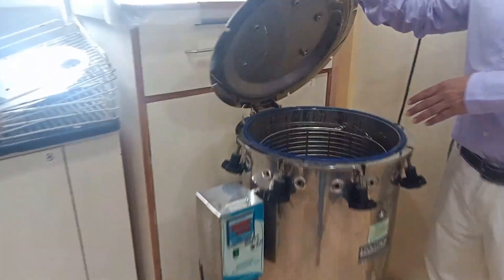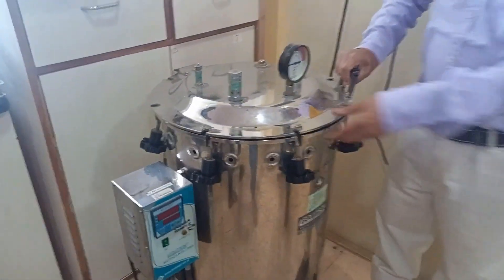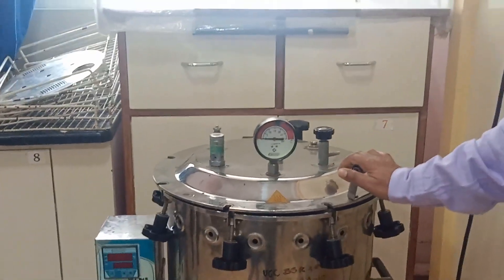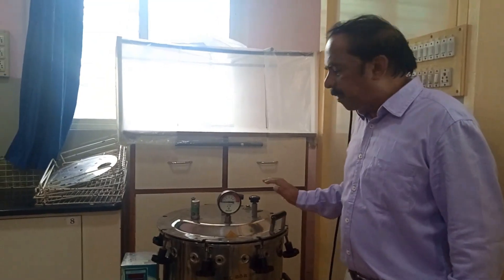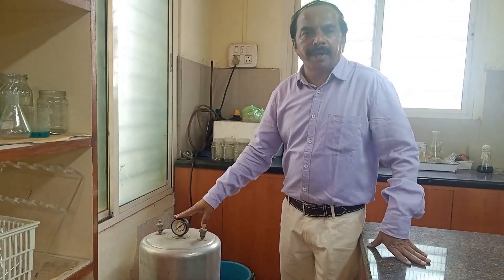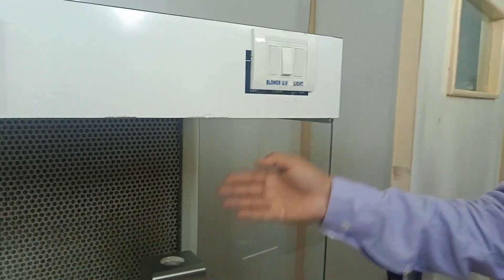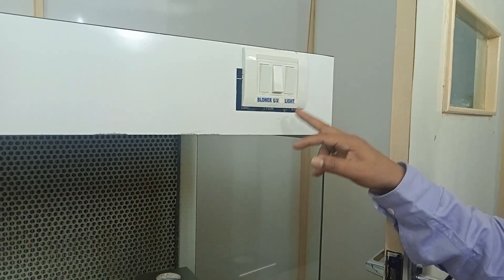Once the nutrient media is prepared and placed inside the autoclave, the lid is closed and pressure is monitored on this meter. This is an automated autoclave set at 121 degrees centigrade at 15 pounds. This is one more small-sized autoclave, which is usually used for preparing nutrient media for bacterial cultures. This LAF has three components: the blower that blows clean air from the opposite side, the light, and the UV — I am not switching on the UV as it is dangerous.